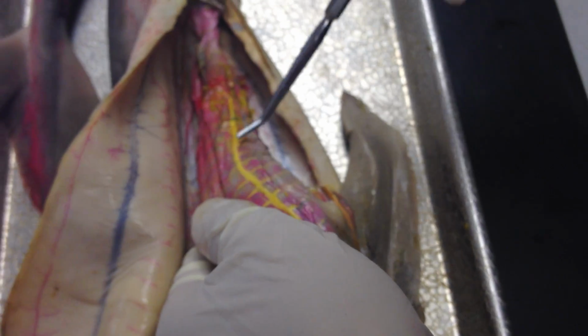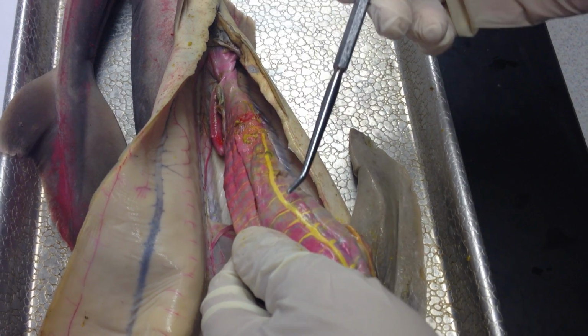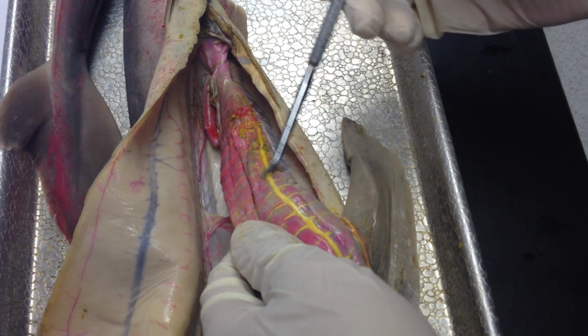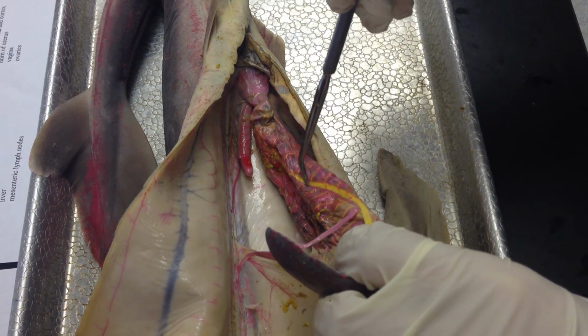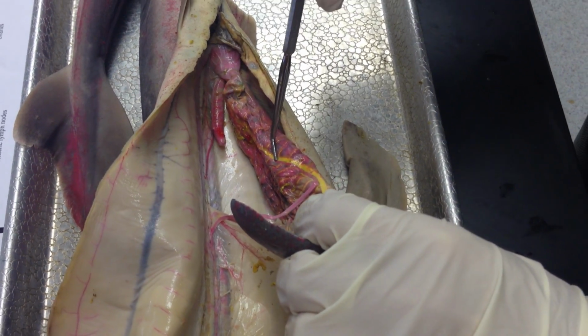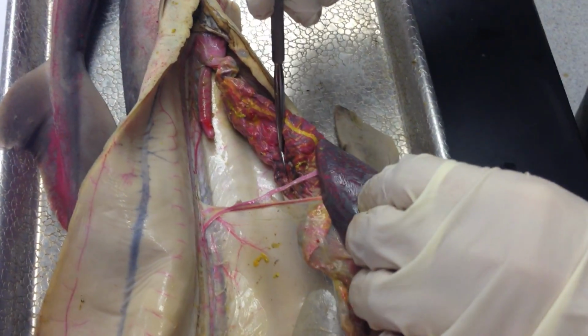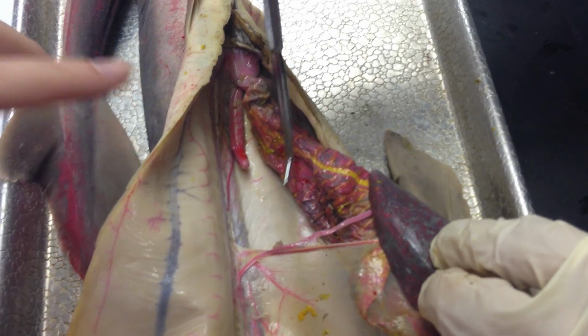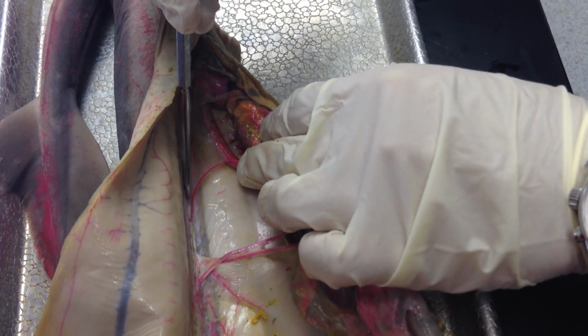So it was just underneath this vein, because there's a red coming off this also. So the artery is just underneath this, and that's anterior intestinal artery. Posterior intestinal artery would be this. And posterior mesenteric artery, would that be this? It's the one that goes to the digitiform. Okay. Alright. So that's this.